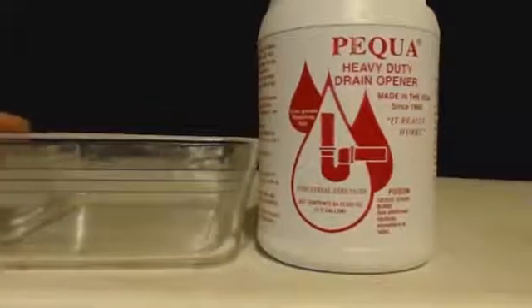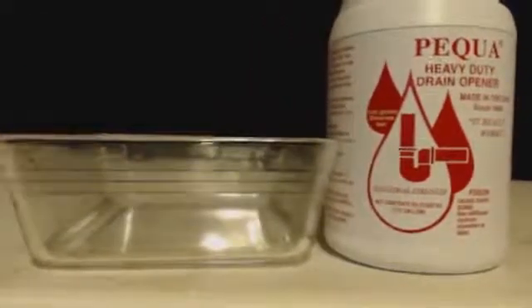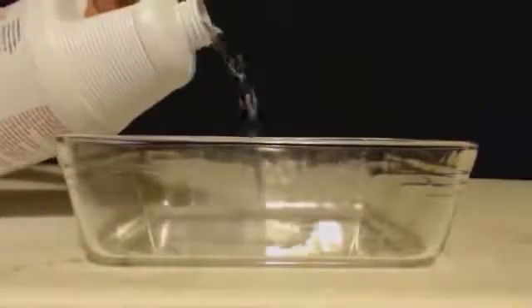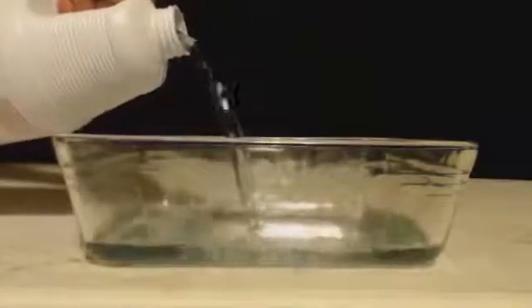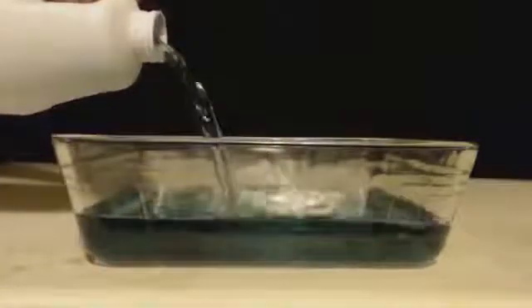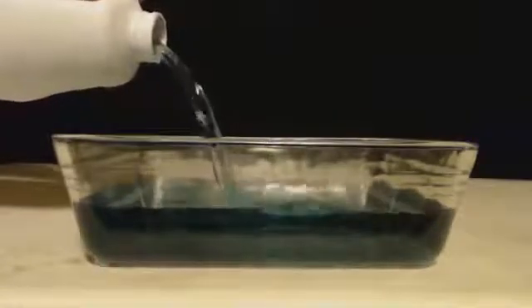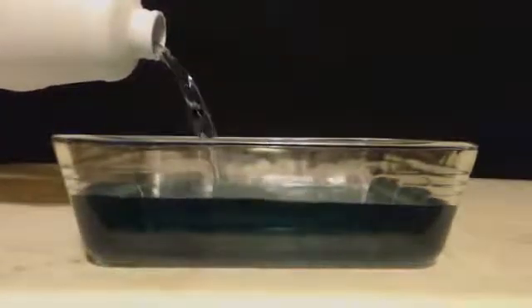When you heat it up, it turns into like an iron oxide. What I figured out is just heat it up first. We're going to get a Pyrex dish - the bigger the better, because the more surface area, the easier it will evaporate. It should be nice and crystal clear if it was only potassium hydroxide.